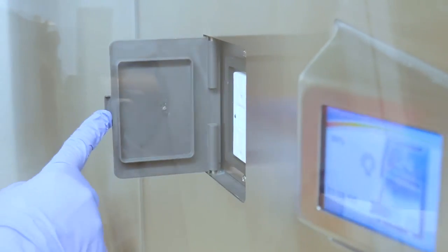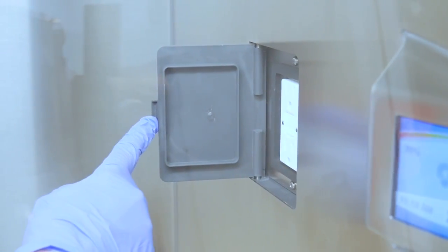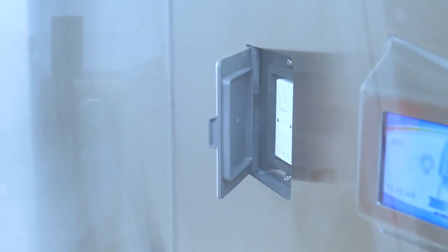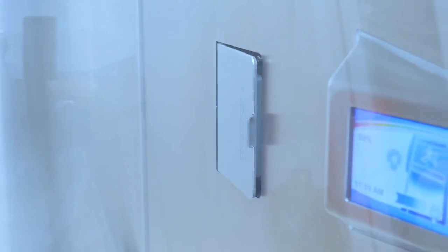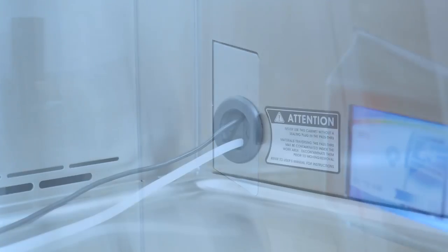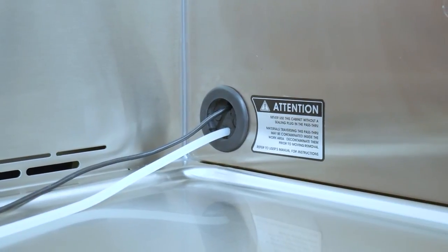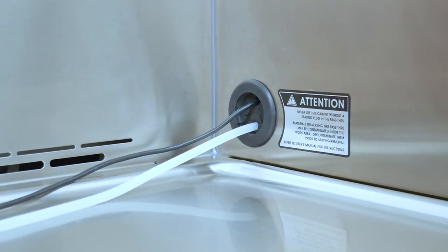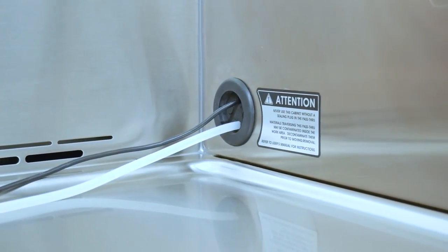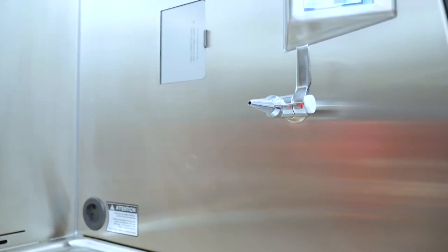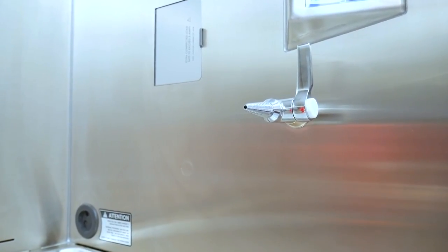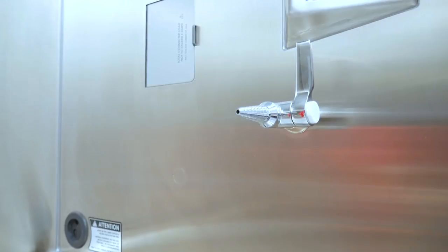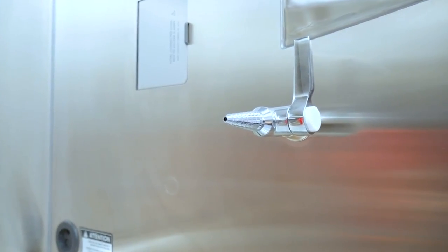Power is available on either side of the biosafety cabinet. These soft-closed doors have a flush cover and may be fully disinfected after use. Additional tubing may be run out of the biosafety cabinet through an optional NSF-approved negative pressure port. Service fixtures provide vacuum, gas, or liquid to the cabinet interior. Up to two may be added per side.